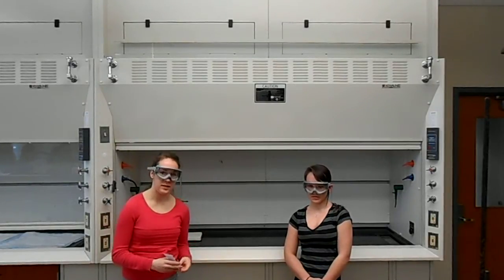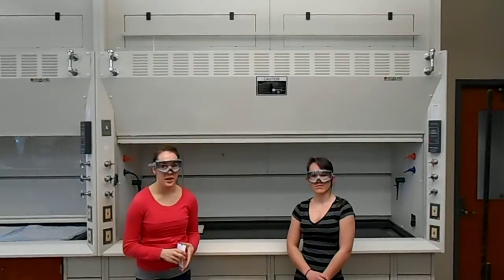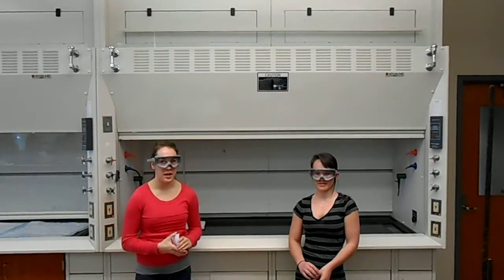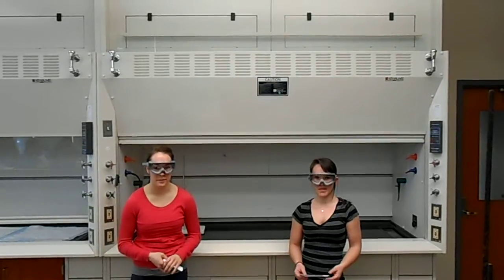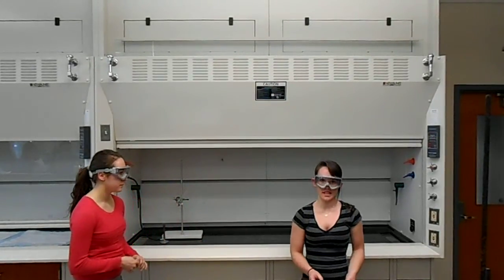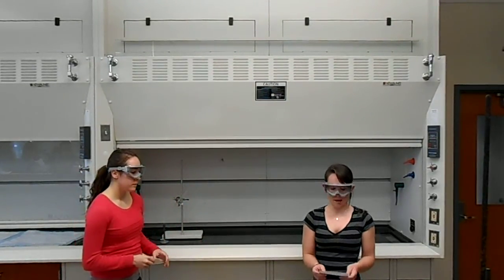In this experiment, you'll be able to see the amount of energy that is extracted through the process of oxidation of sucrose, in this case, the sugar in the gummy bear. The sugar is what fuels the experiment and fuels the chemical reaction, and because of this, the combustion occurs.